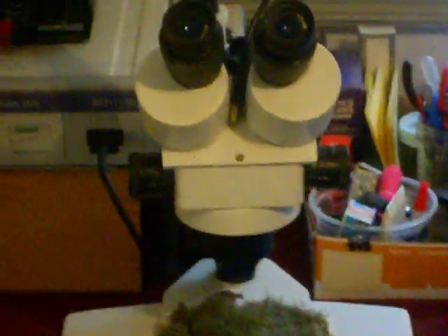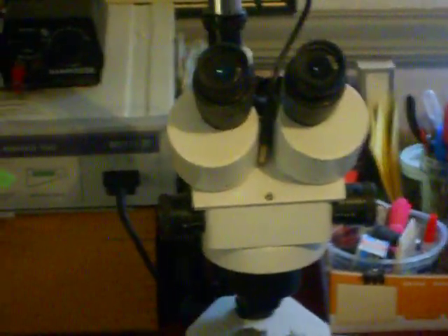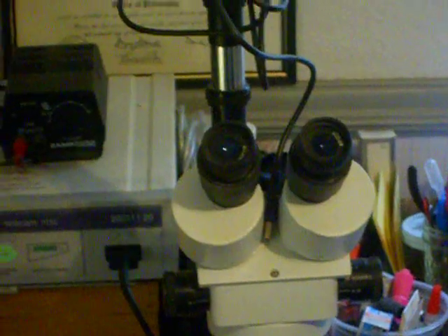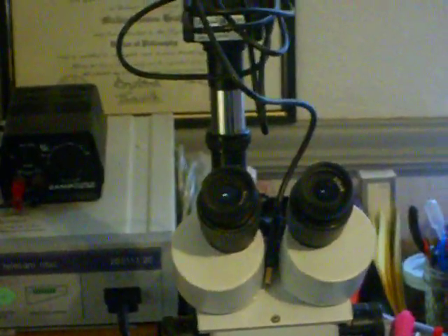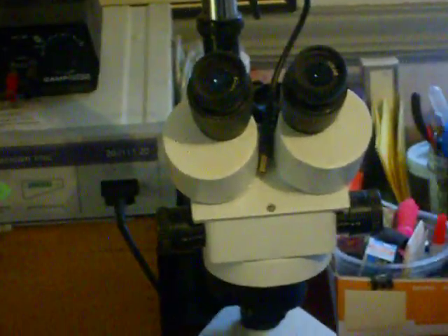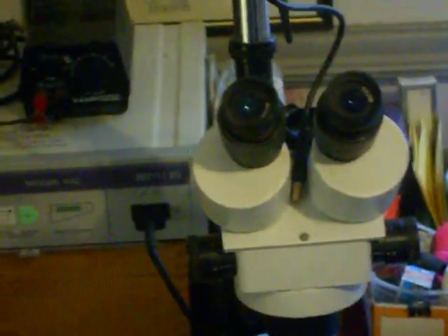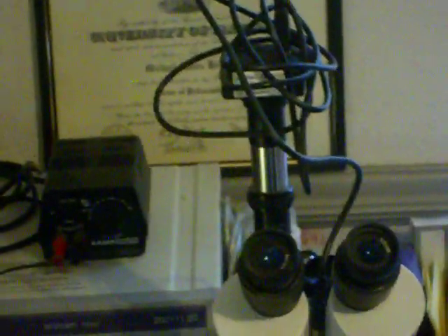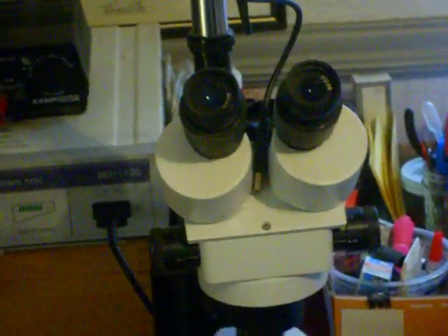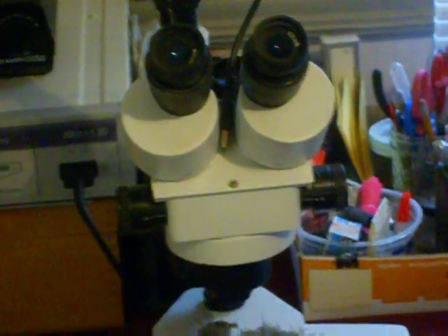Okay, now let's go to the duo of microscopes that you will need. The first one I'm suggesting you get is what is called a dissecting scope, or some people call it a stereoscope. Notice this has a third tube that allows you to put a digital camera and still use the 2 ocular pieces. You can actually get any kind of scope that will allow you to use a digital camera, but the problem is you have to use one of the 2 ocular ports, and it makes it difficult to view and get ready to take a picture at the same time.